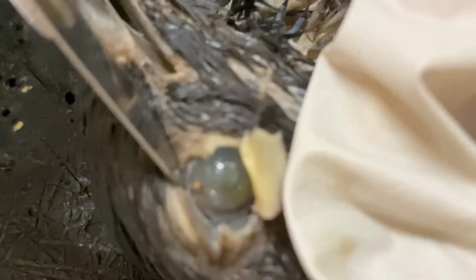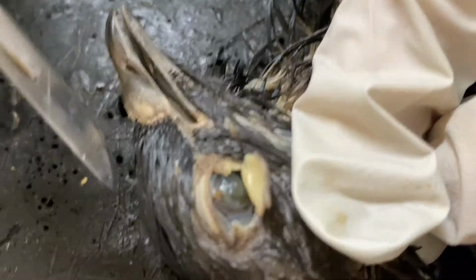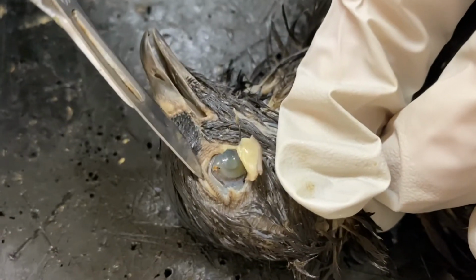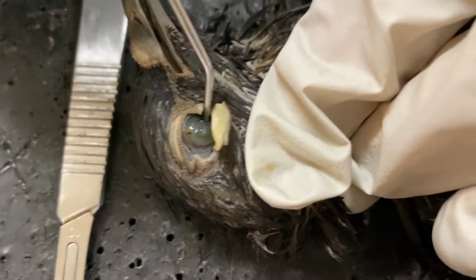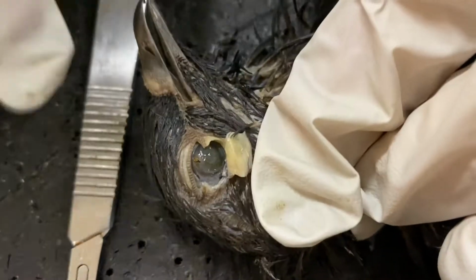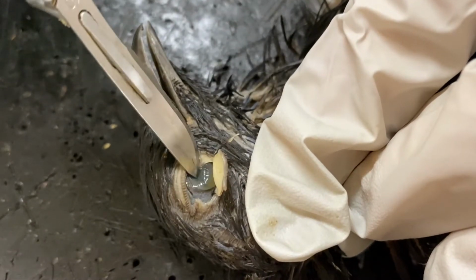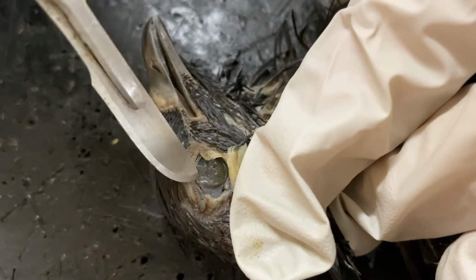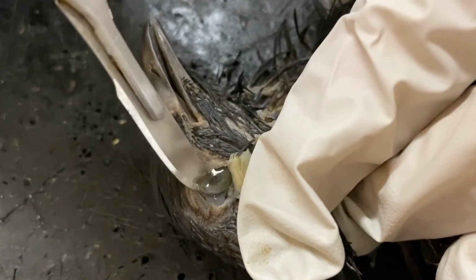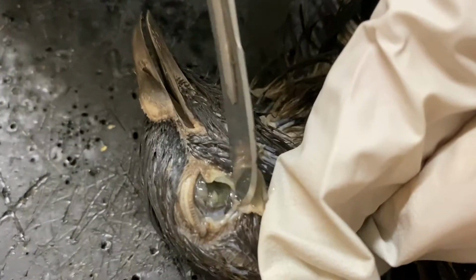Maybe. So blurry. Maybe try zooming out a little bit, or backing off a little bit. You can see the different color, just like ours. If we cut the eye open, you can see it's not hard, just like ours is not hard. Whereas some of the other organisms we looked at did have it, and you can see the vitreous humor come out when I cut it open.